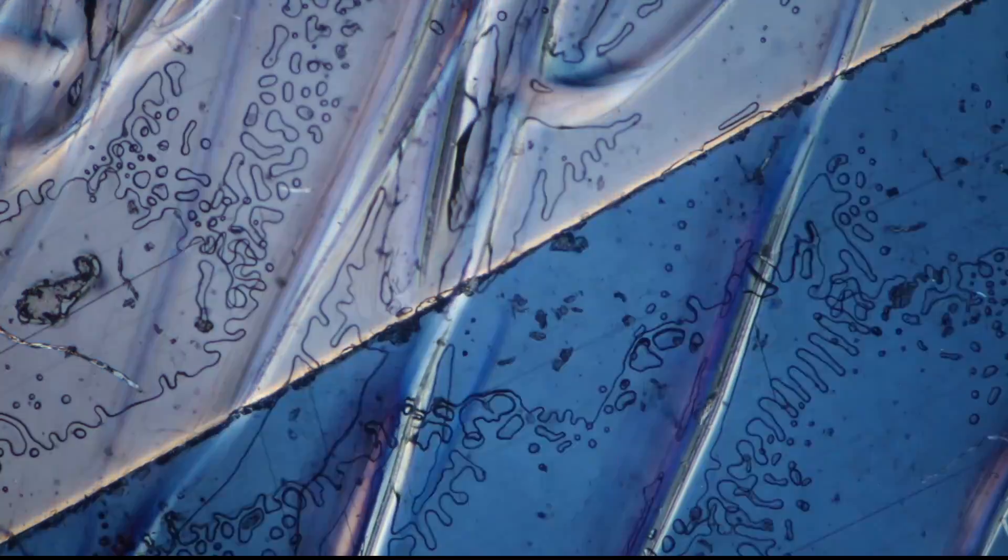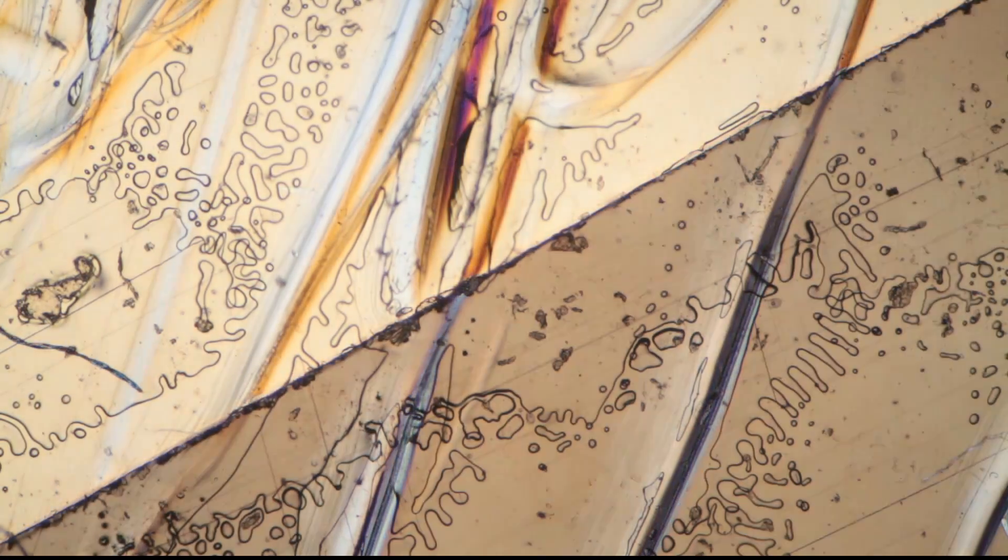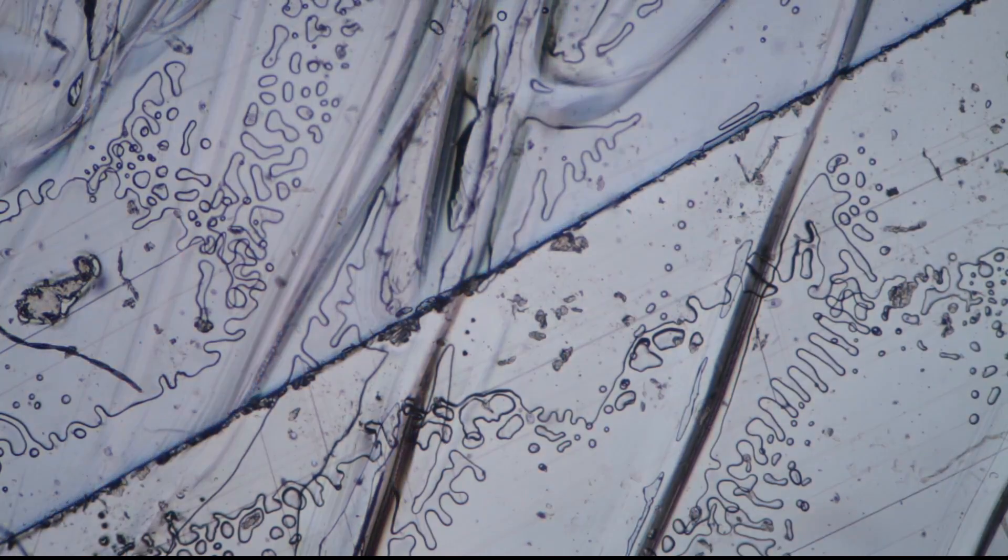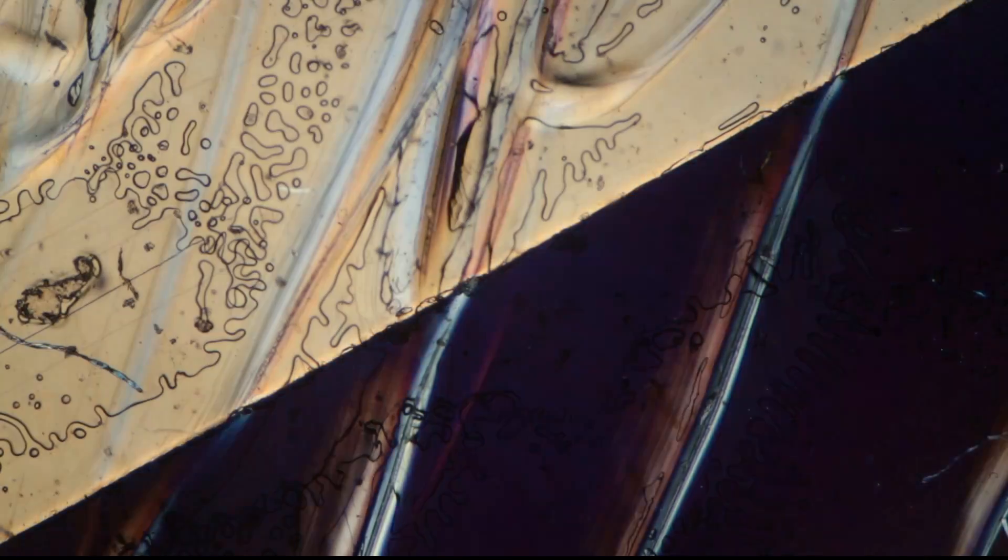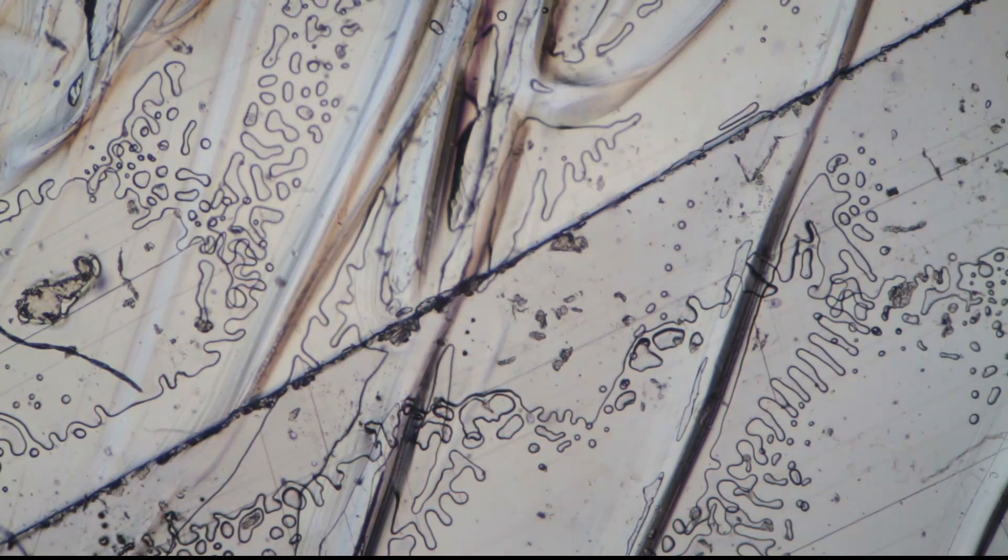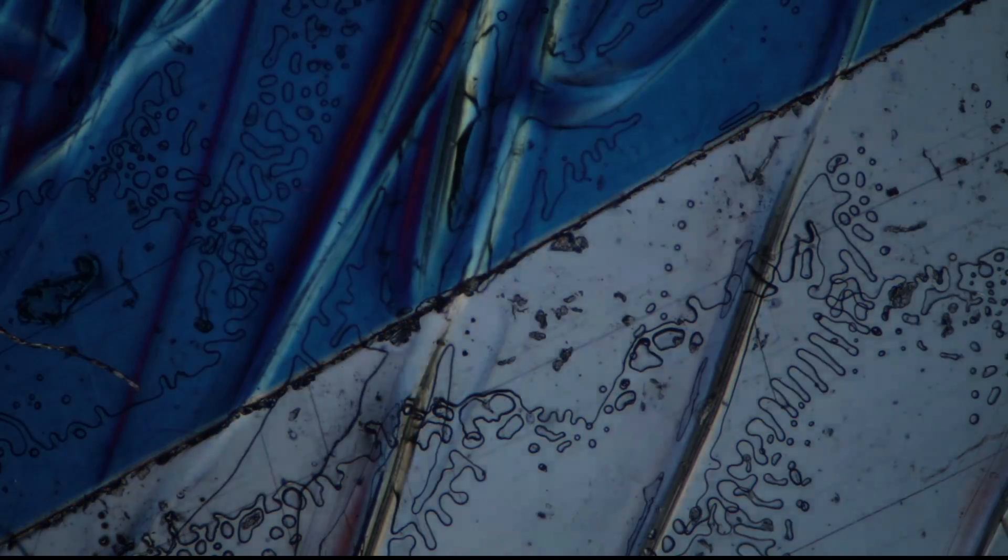Here we go again a little bit, and one of the reasons why this works so nicely is because the sticky tape or the polymers, the plastic polymers, are arranged in a pattern. In this way it changes the polarization of the light.